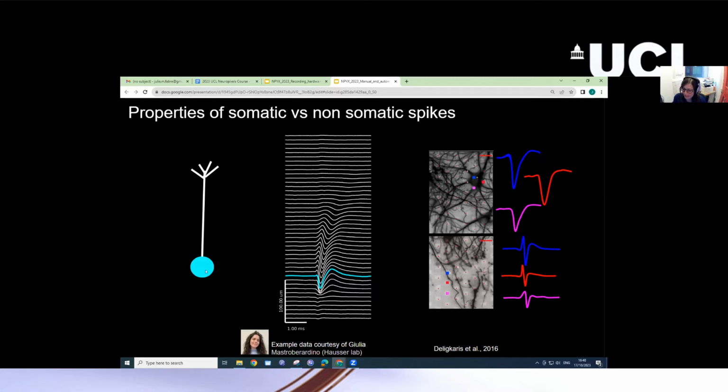Here you can see an example pyramidal neuron that's been recorded in a way where the Neuropixels probe was parallel to this neuron's dendritic tree. You can see the site closest to the soma, highlighted in cyan, has a nice somatic waveform. And as the spike back propagates along the dendrite, you can see that the shape changes drastically. Most particularly, there's an initial peak that is more pronounced, or even appears, in the dendrite as compared to in the soma.